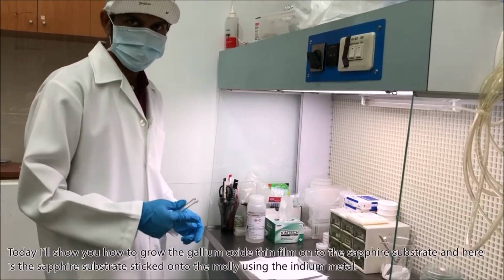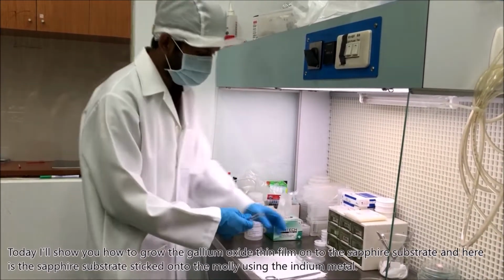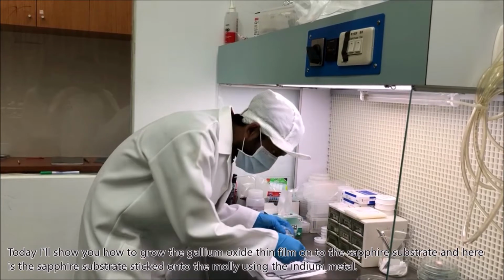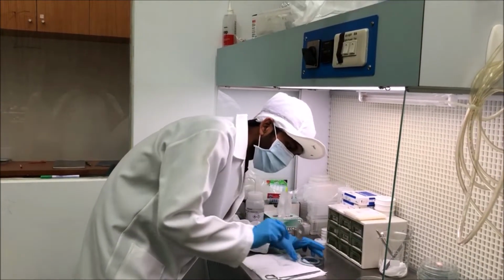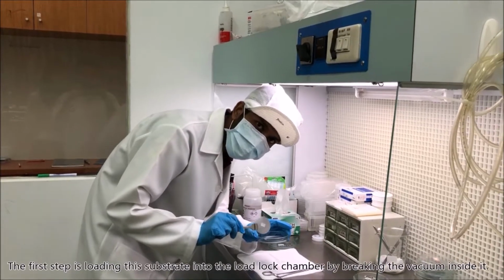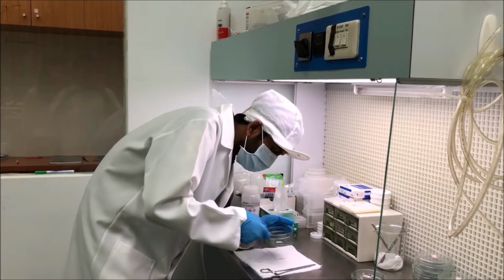Today I will show you how to grow the gallium oxide thin film onto the sapphire substrate, and here is the sapphire substrate stuck onto the moly using the indium metal. The first step is loading this substrate into the load lock chamber by breaking the vacuum inside it.